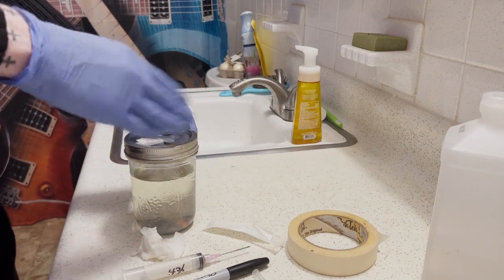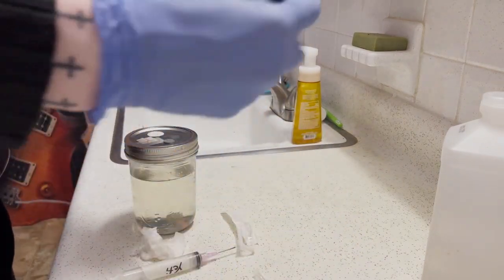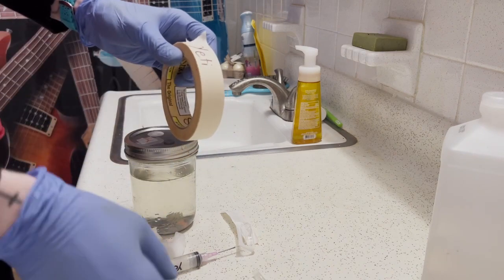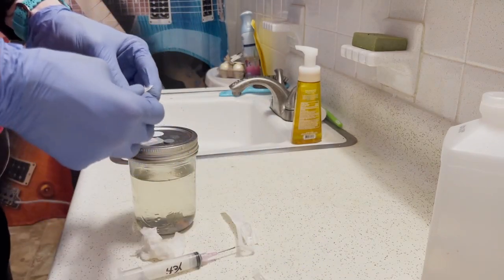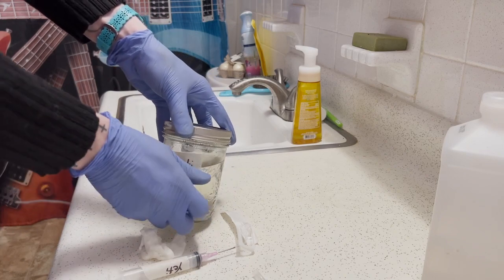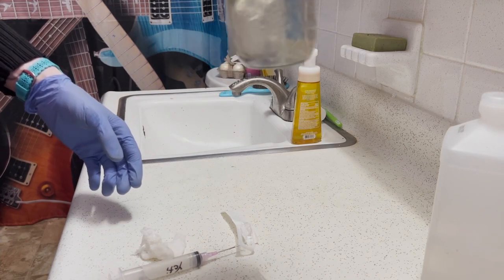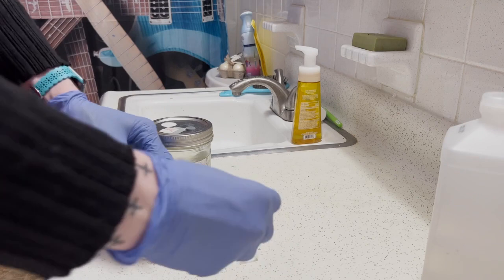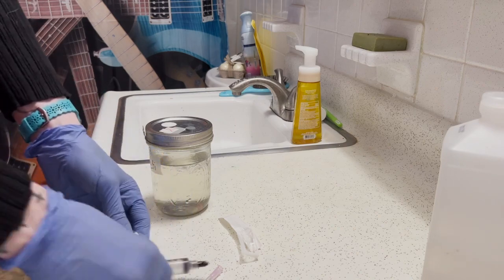You want to be very careful. I'm going to go ahead and label my jar. Once labeled, I'm going to mix this around and stir it well. You're going to want to take this out and stir it once a day. It could take a couple of weeks or even a couple of months depending on the culture. Your culture is ready when — before your daily stir — the jar is about half full with fuzzy mycelium growth. Once it's eating the corn syrup and about half full, that's when it's ready. Put it in the fridge and date it for up to eight months.